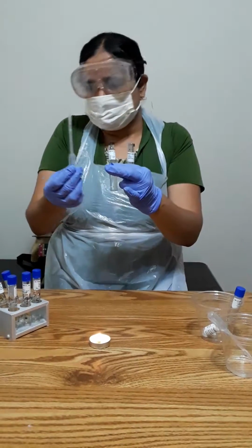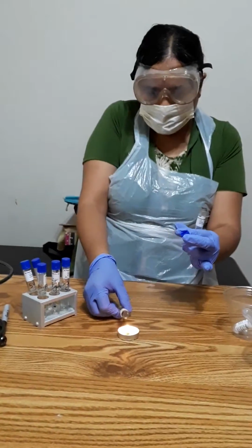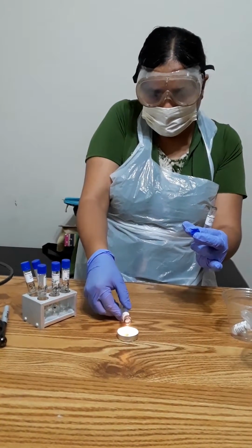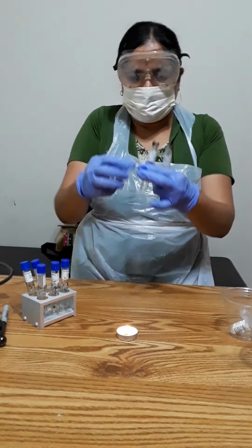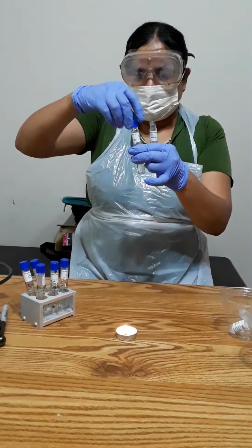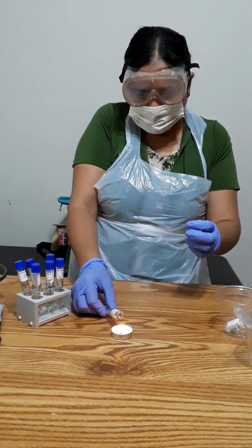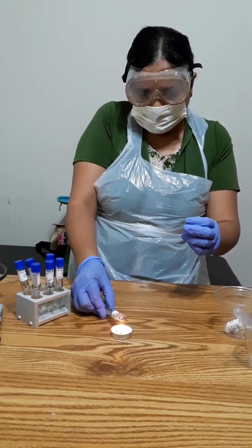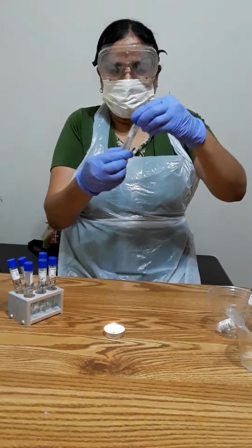and this I'm going to throw in the undiluted bleach solution, and before closing I'm going to sterilize it. Close it. And this culture tube too. Close it.